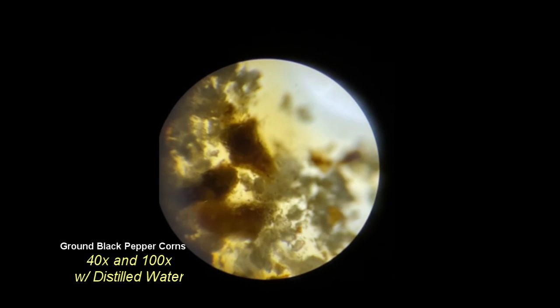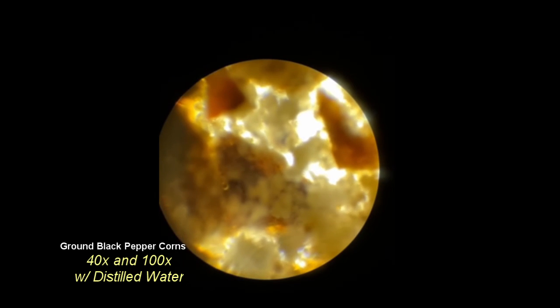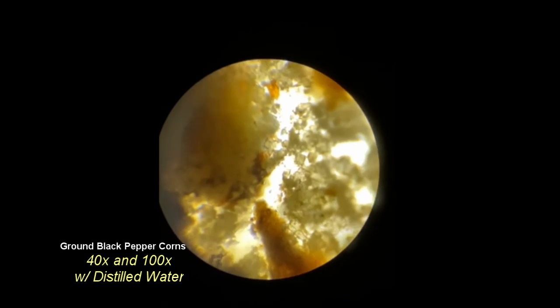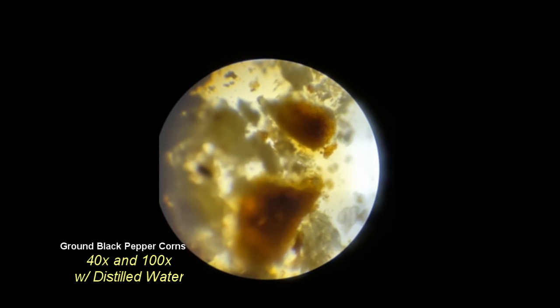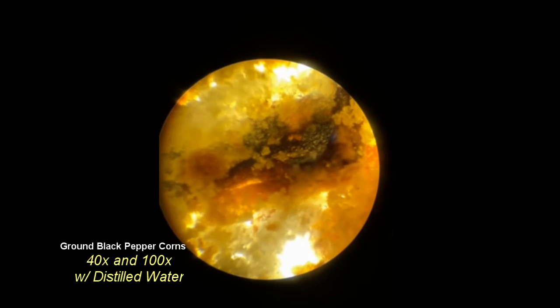In this visual, some of the more brown particles can be seen leaching a darker color into the surrounding water. This, again, is likely either ultrafine particles or a soluble component attached to the peppercorns. By contrast, the first filtration of the sand resulted in crystal clear water with no signs of visible particles.